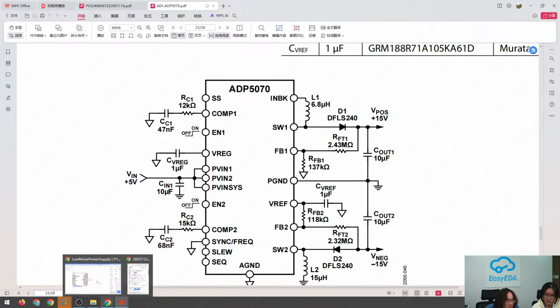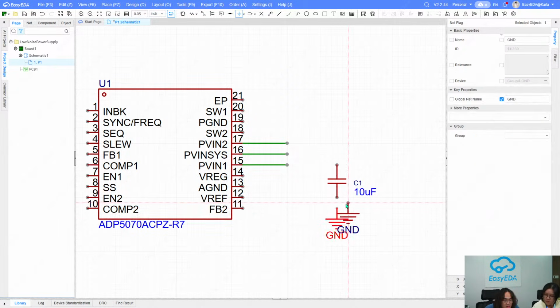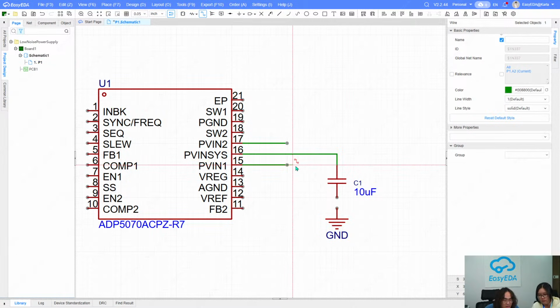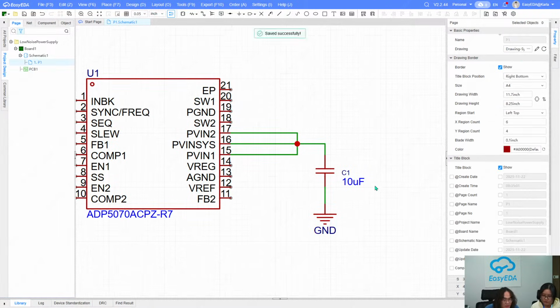And yeah, this is 3. We just copied it. So copy it. We can place it in here, this is ground. Here is for the digital. Digital one. Connect to the ground. Okay.